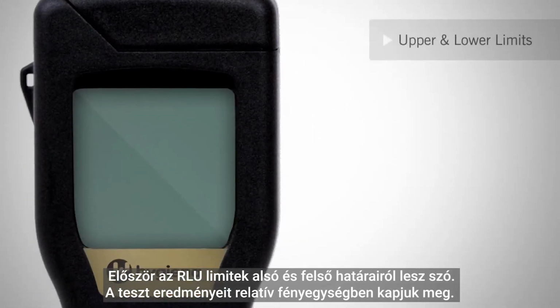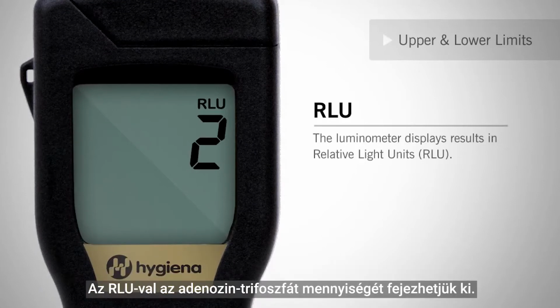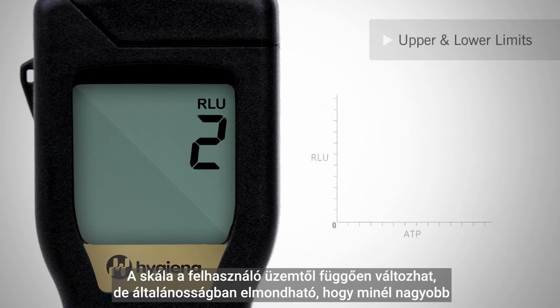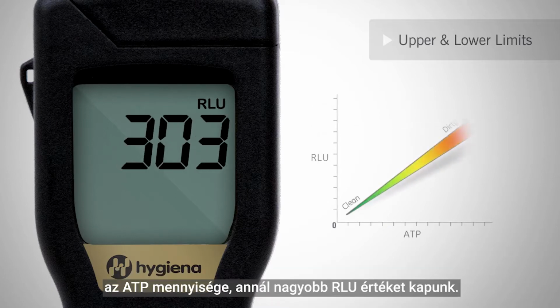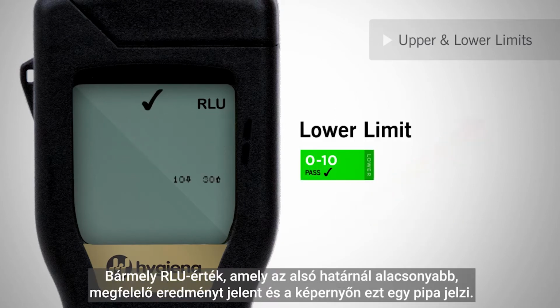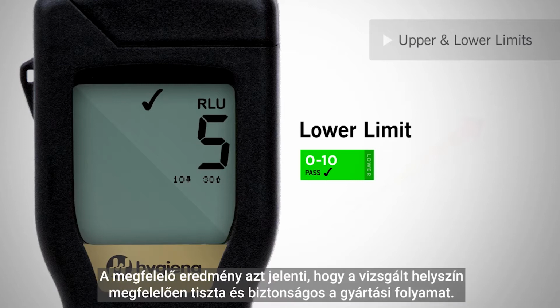Test results are measured in relative light units. RLUs are a unit of measure for adenosine triphosphate. The scale varies depending upon manufacturer, but the greater the amount of ATP, the greater the RLU number. Any RLU score less than the lowest threshold is a pass and will be indicated by a check mark on the screen. Pass results indicate that the location has been cleaned properly and it is safe to continue production.